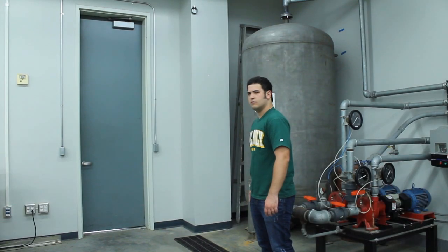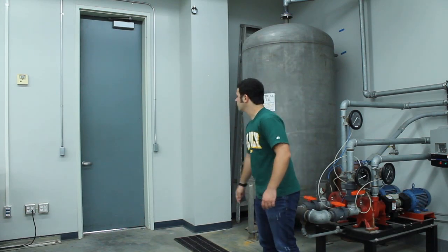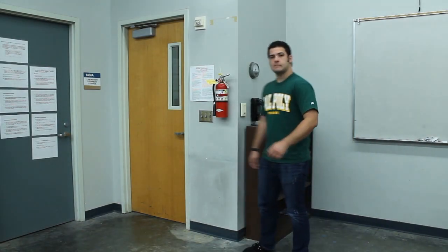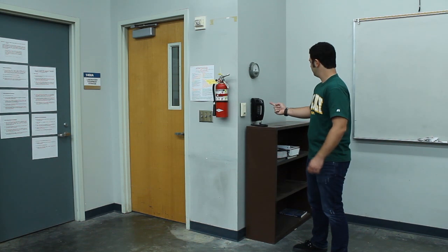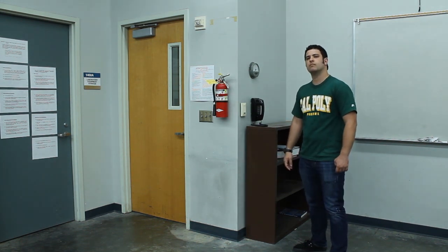First, let's find the emergency exit. Very good. If it's not safe to exit through the main door, you may exit through this door to safety. You should also know the locations of the fire extinguisher and the lab phone. Your instructor will show you where the fire blanket, first aid kit, and eyewash are located as well.